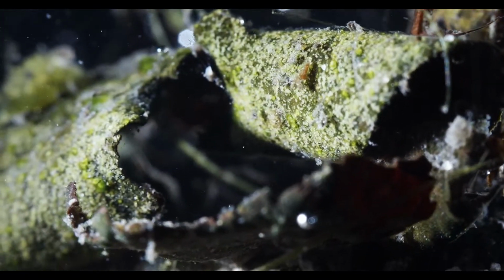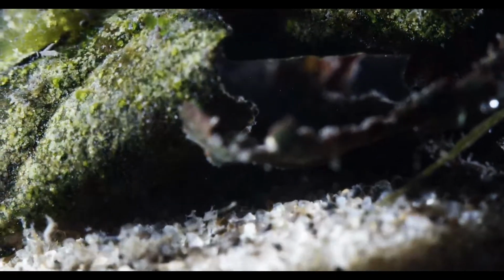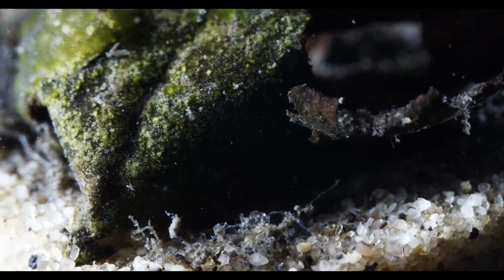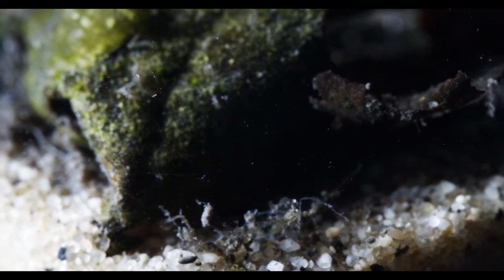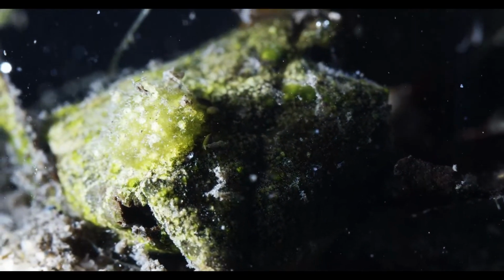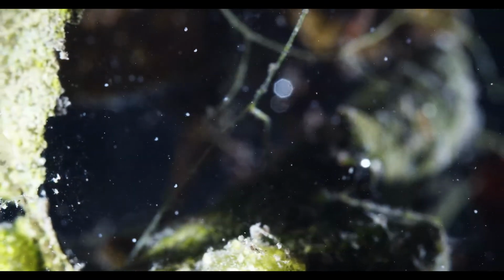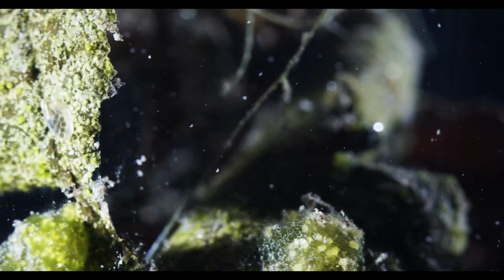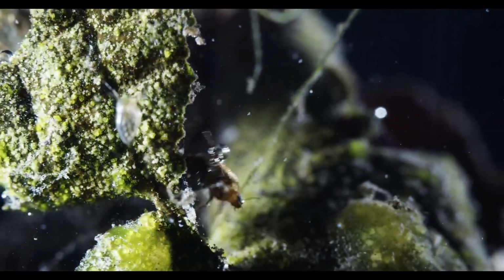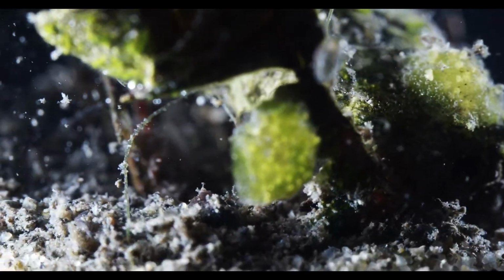But yeah, I mean, did we see the planarian yet? Oh, there's an ostracod zooming around, probably ostracod. Yeah, we'll see what we can find with the other lens, because if we change the magnification we'll be able to see more detail, but it will be harder to find stuff.